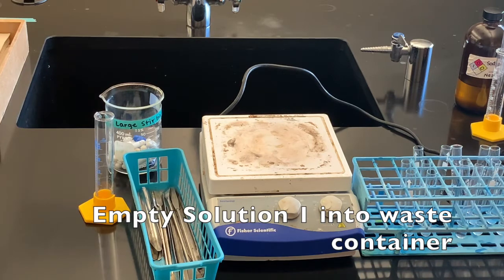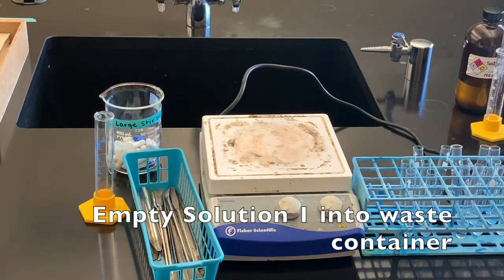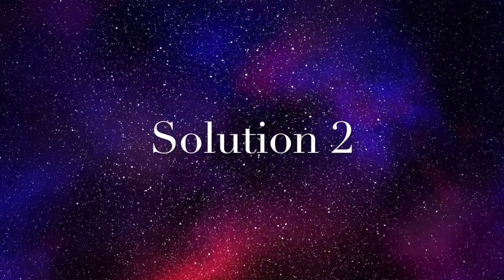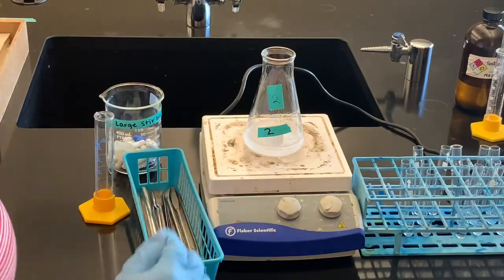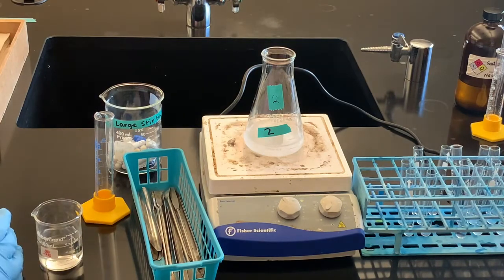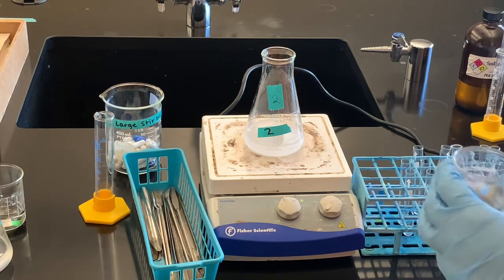I'm going to put solution one in a waste container and clean my glassware, then pick up solution two. I have already added the starch to solution two, so it's good to go when I pour in my beaker. When I pour in this beaker, time is going to start.